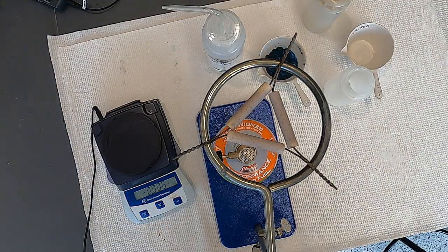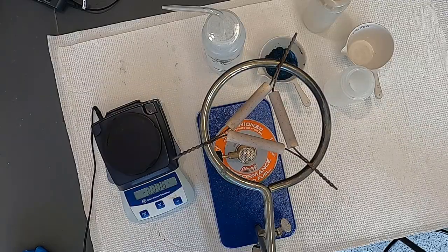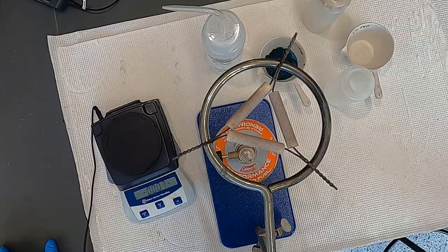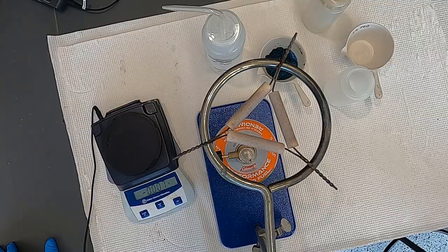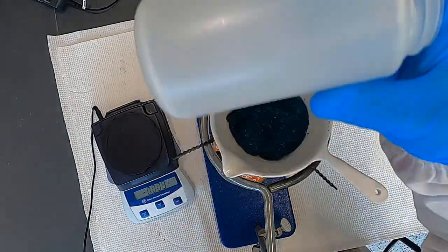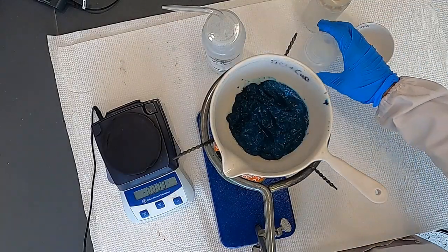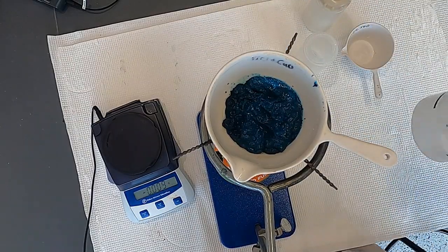Welcome back to the final portion of the synthesis of copper oxide from copper sulfate pentahydrate. In the last videos, we went ahead and we isolated the solid copper hydroxide, and this is what it looks like. It was an arduous task to remove from this bottle here. I did that by scraping it out, and then I used some water to rinse it all.